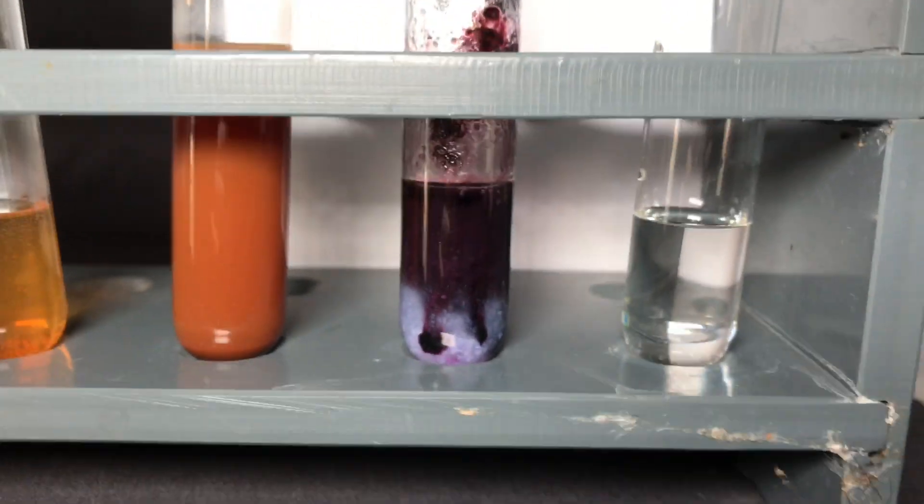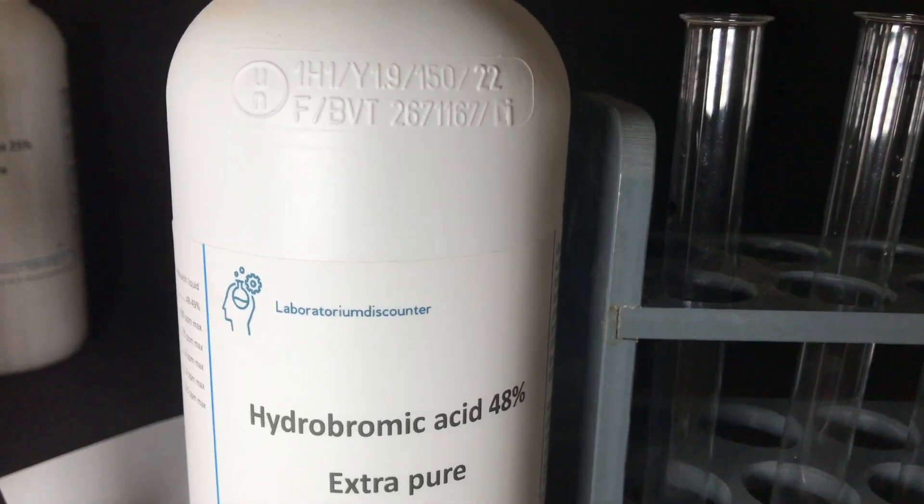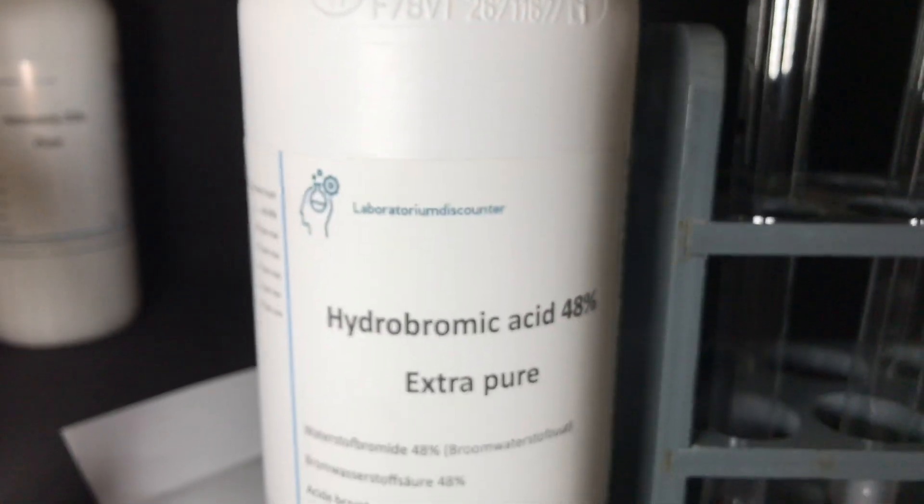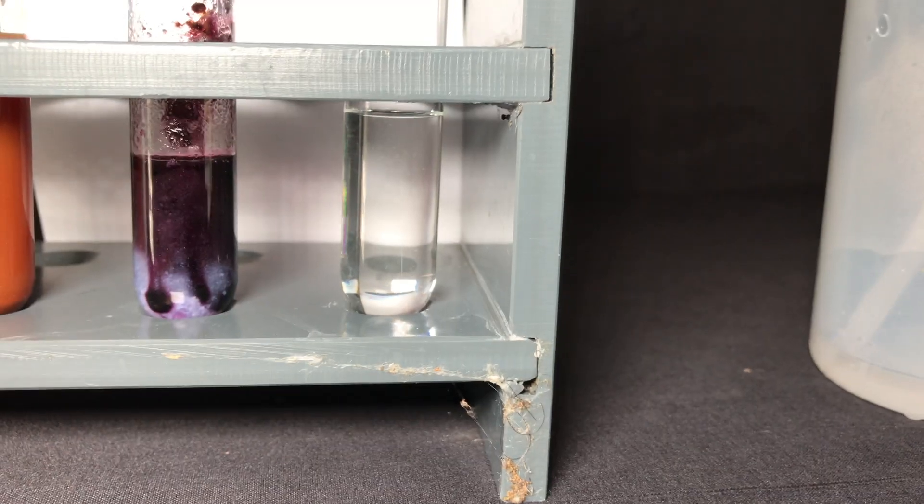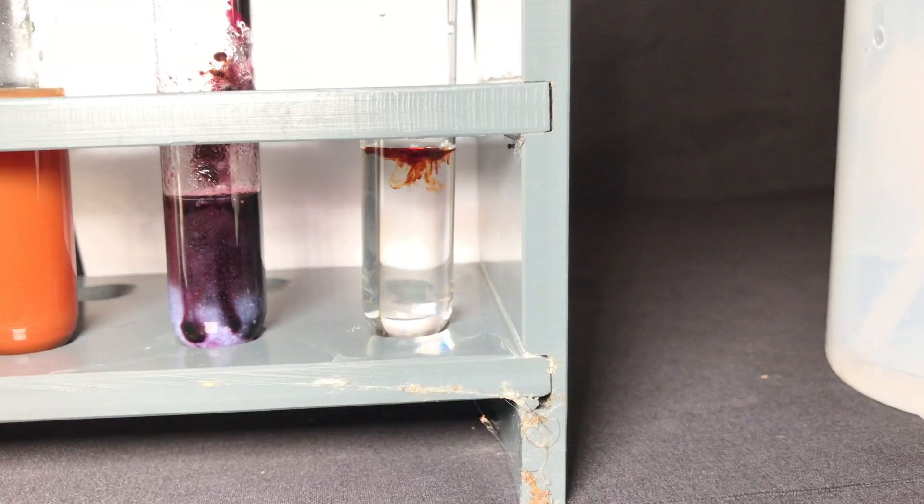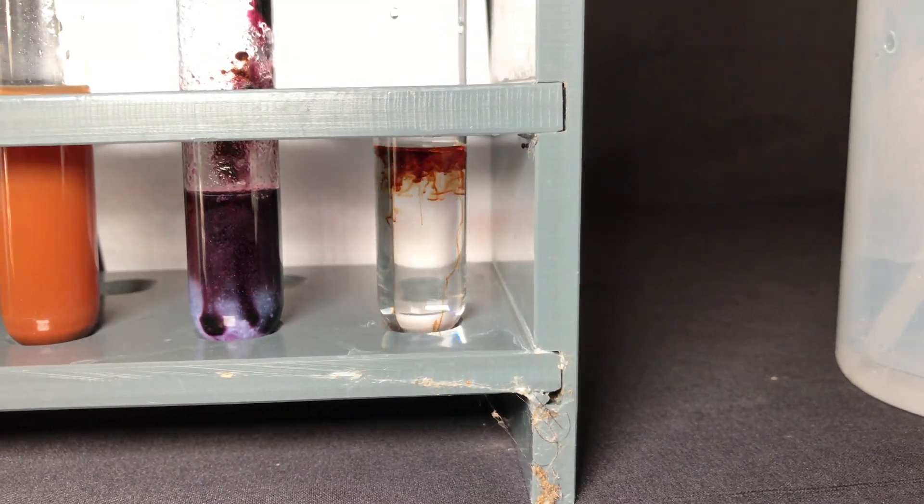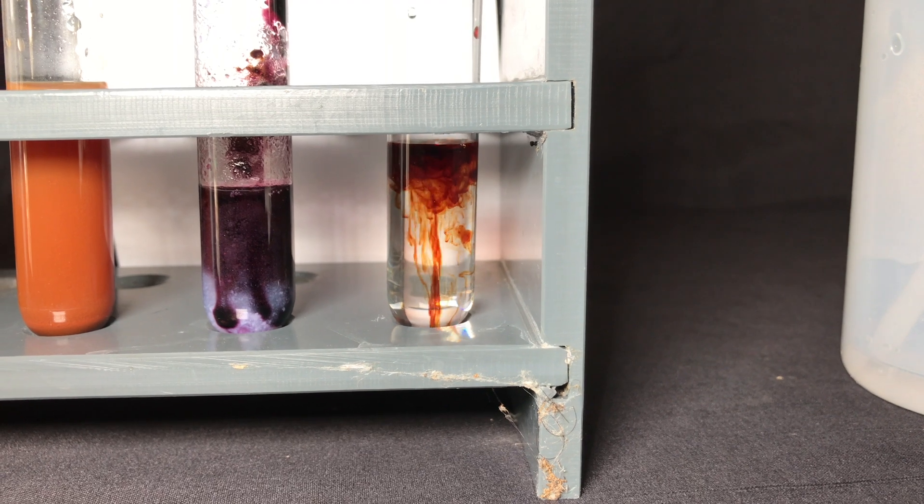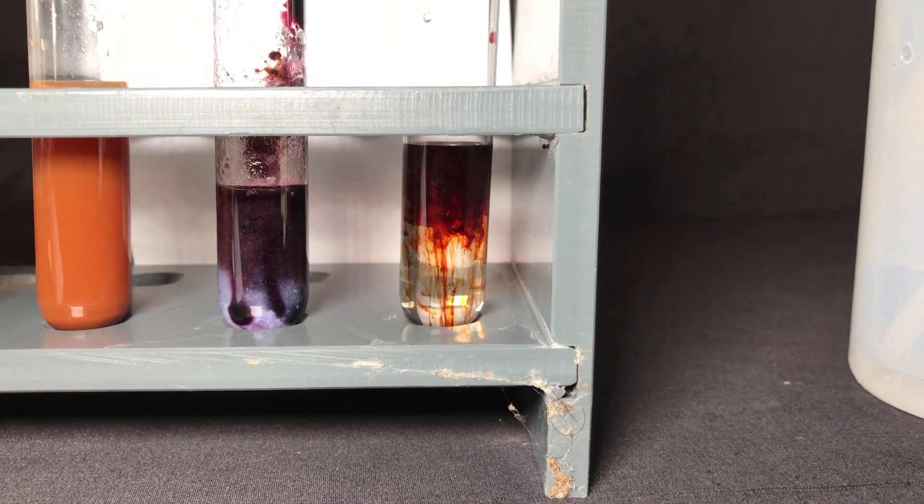If you're looking for a way to make potassium permanganate, do not use this route as potassium ferrate is much more expensive and harder to make. Lastly I wanted to make some bromine water by adding ferrate to hydrobromic acid. This is nothing special and you can use almost any oxidizer for it, but I think it would look cool and therefore I tried it anyways.